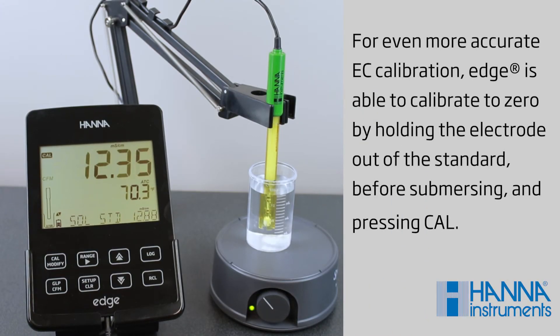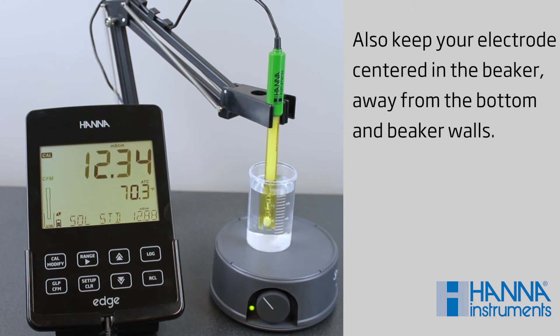The sleeve holes must be completely submersed. The recognized standard will automatically appear on the display. Once stable, press confirm and calibration will save and the meter will return to measurement mode.